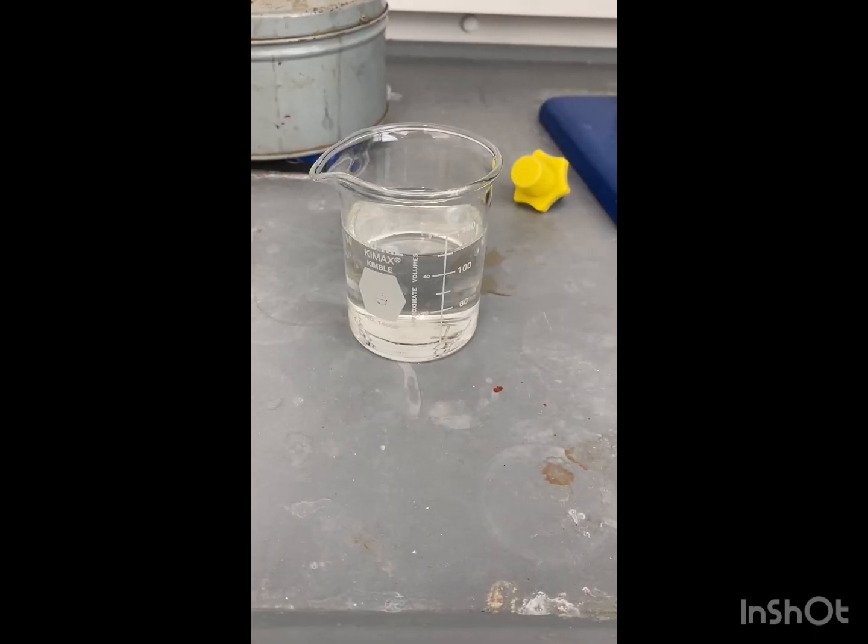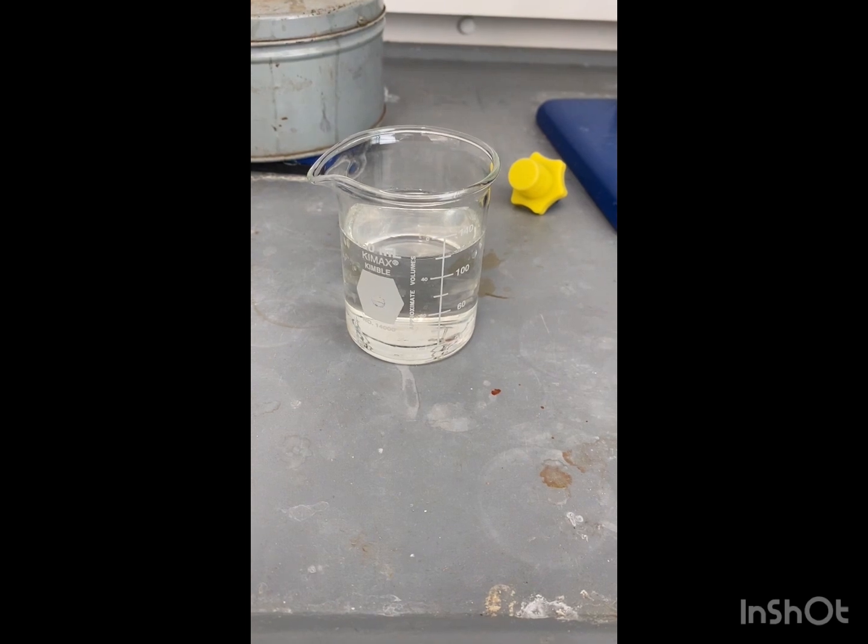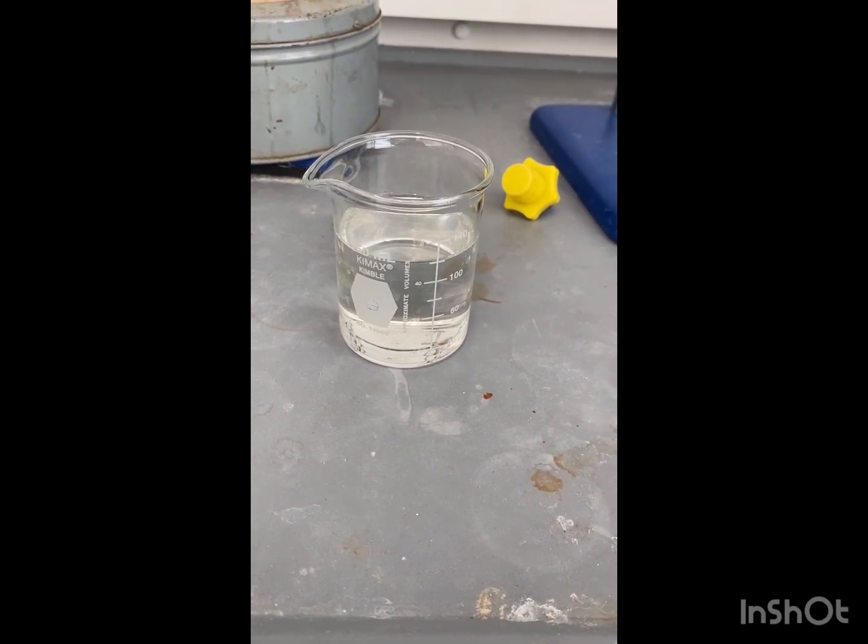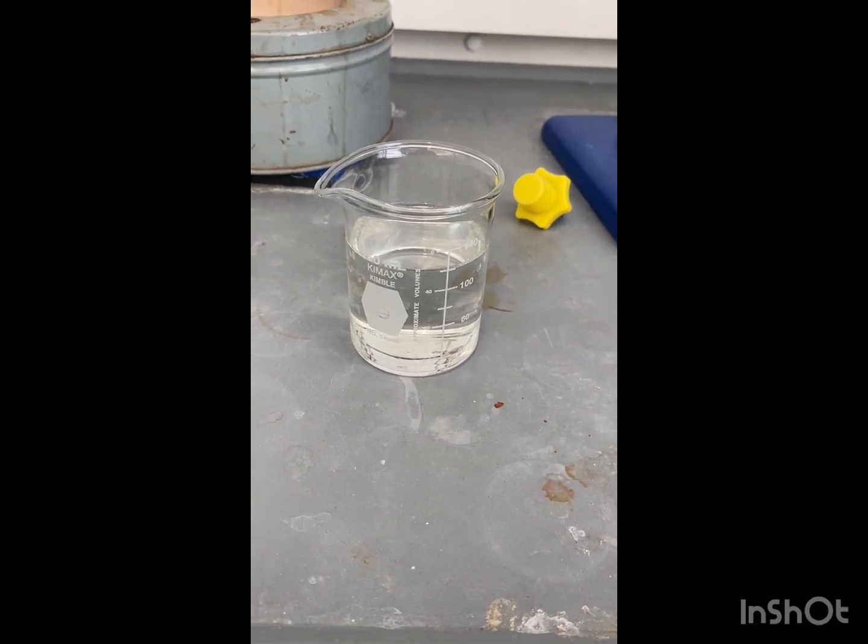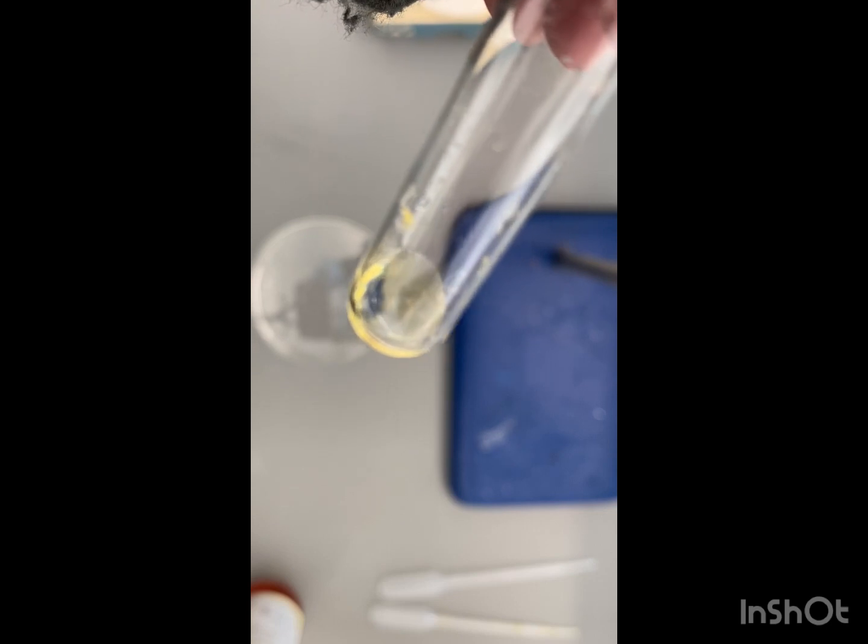Now that we have collected our extractions, we are now going to dry with some sodium sulfate and then evaporate it on the rotavap. This is our product.